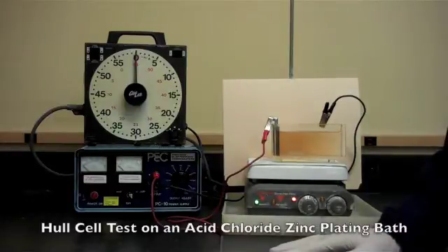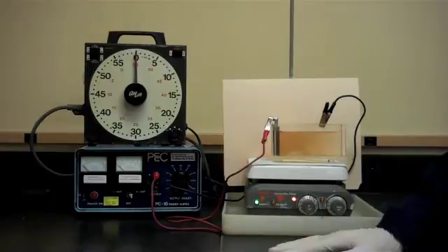In this video we are going to demonstrate the Hull Cell test. The Hull Cell test is widely used in the electroplating industry as a troubleshooting tool and also in research and development.